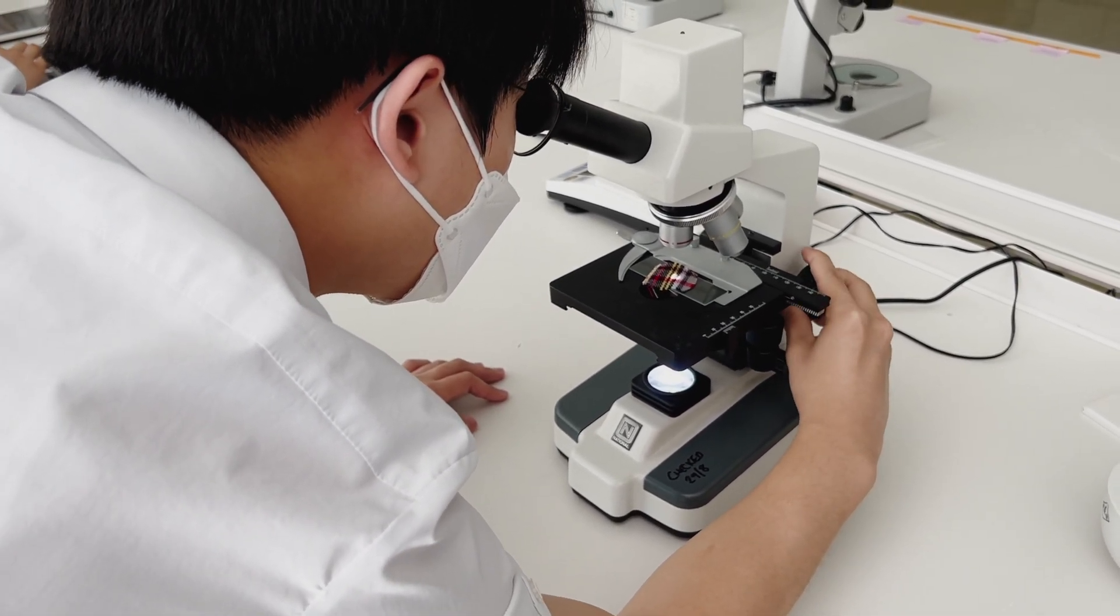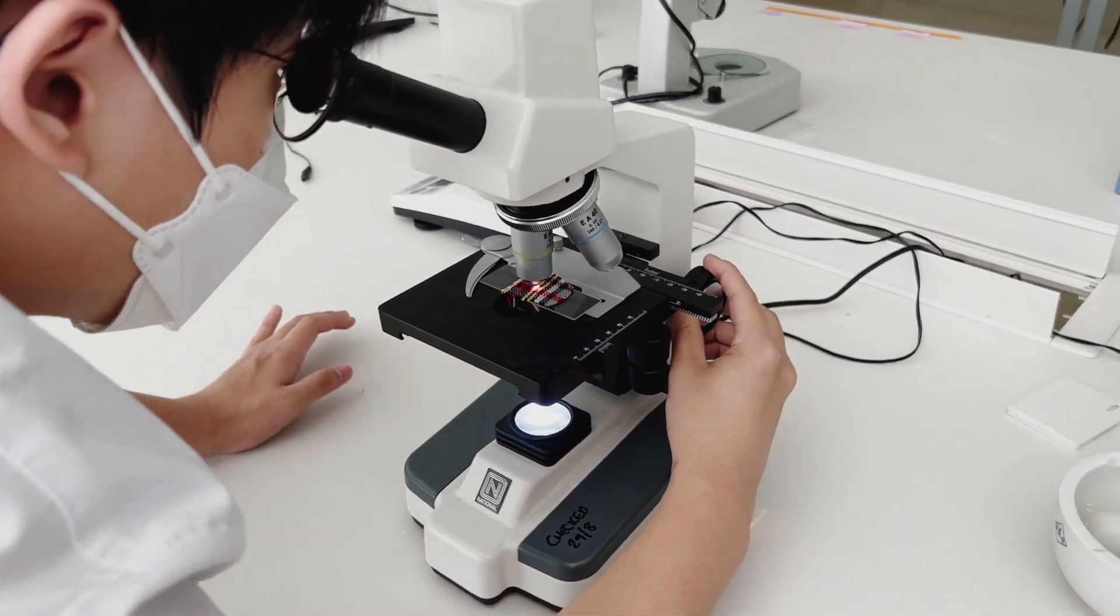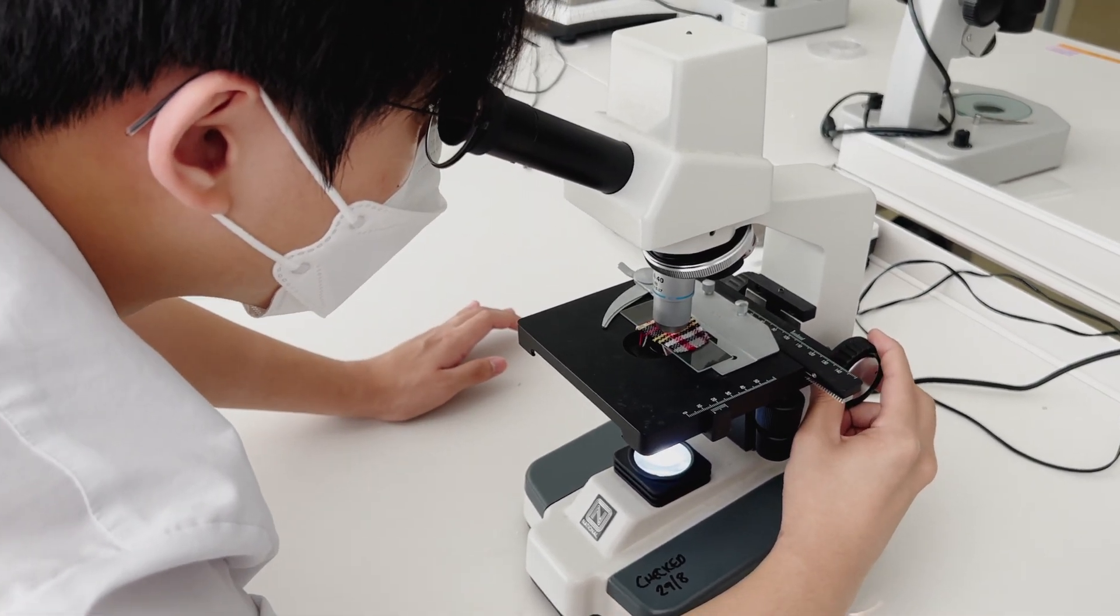You can do this by rotating the focus knobs. Do note that it's best to use the lowest magnification for the first round and increase your magnification step by step.